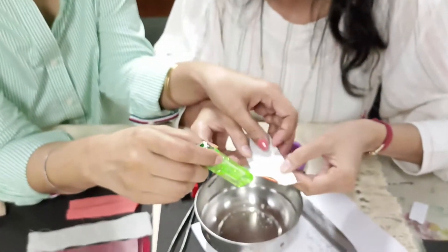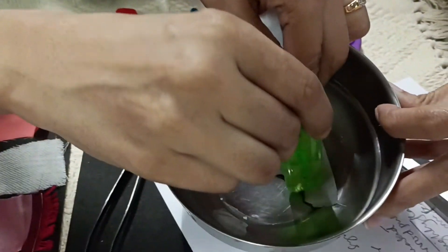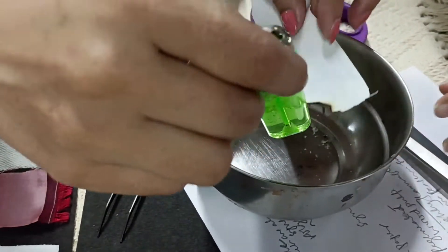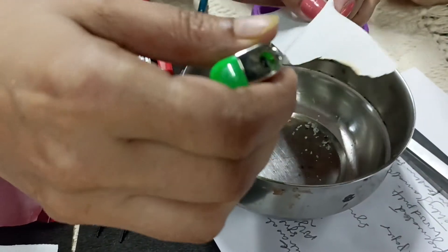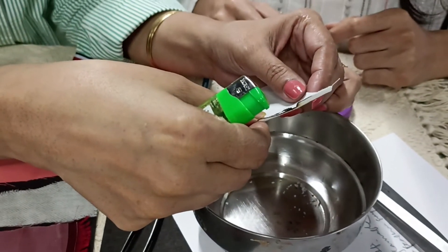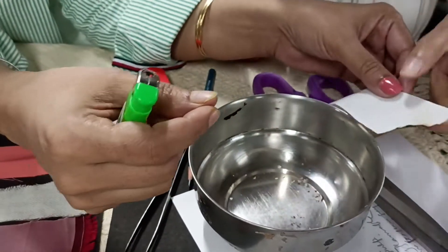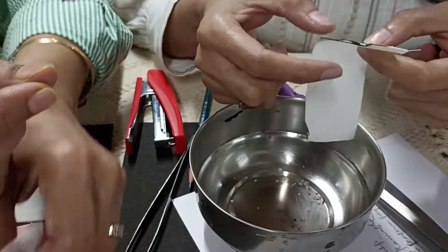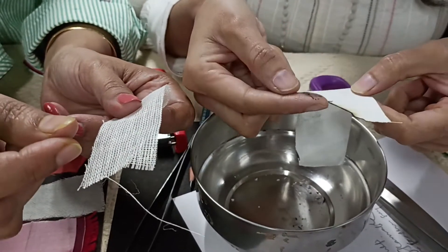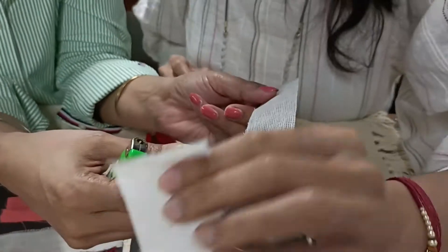Extinguish the fire immediately inside a metal plate or bowl if you have one. Be careful — do the burning test outside. Don't sit on your sofa or near any wooden material which is highly flammable. These are the edges you can observe, and if you try to take out the residue, it is easily crushable and soft in nature. This was cotton.